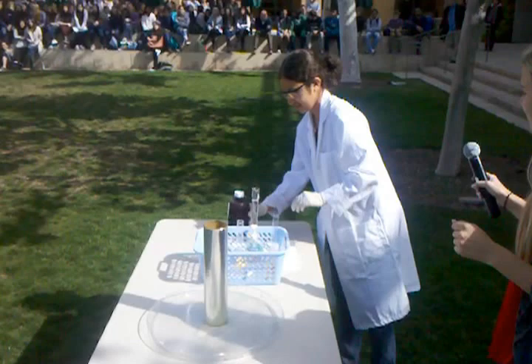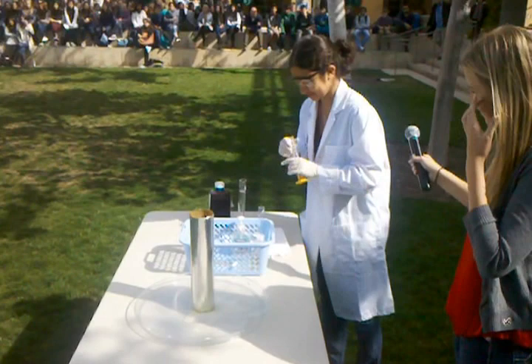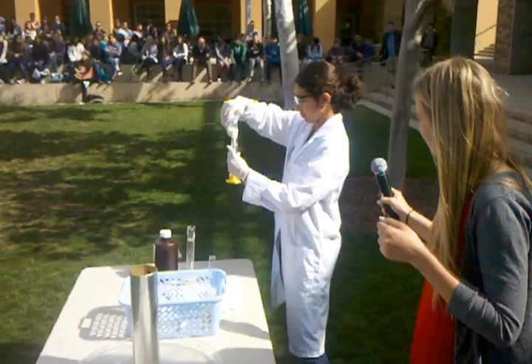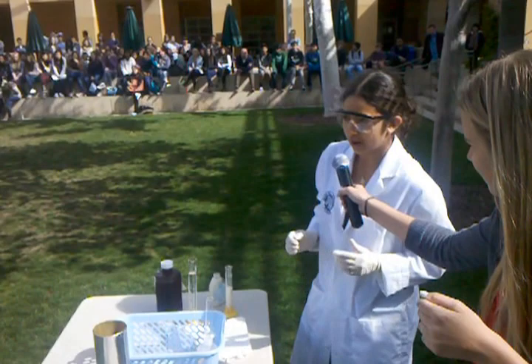Alright, then 30 milliliters of soap. Then 25 milliliters of sodium iodide.